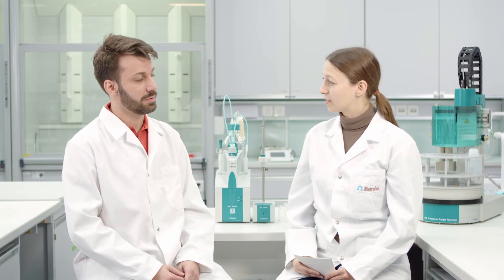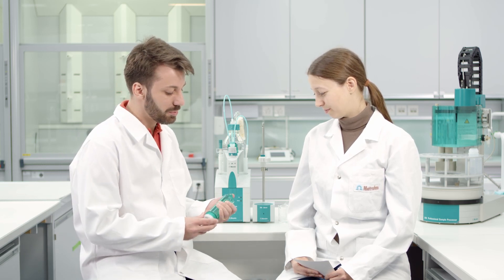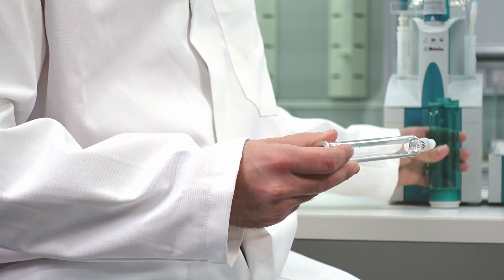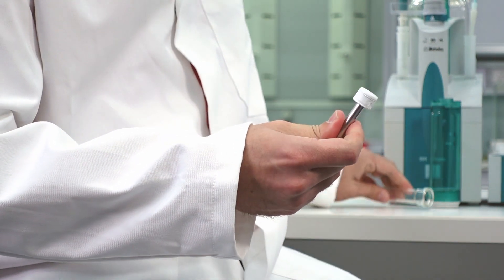Can you give us an example? Sure, I have here with me a burette that was trying to be repaired for a leakage. And you can see here, someone has applied a Teflon tape here.